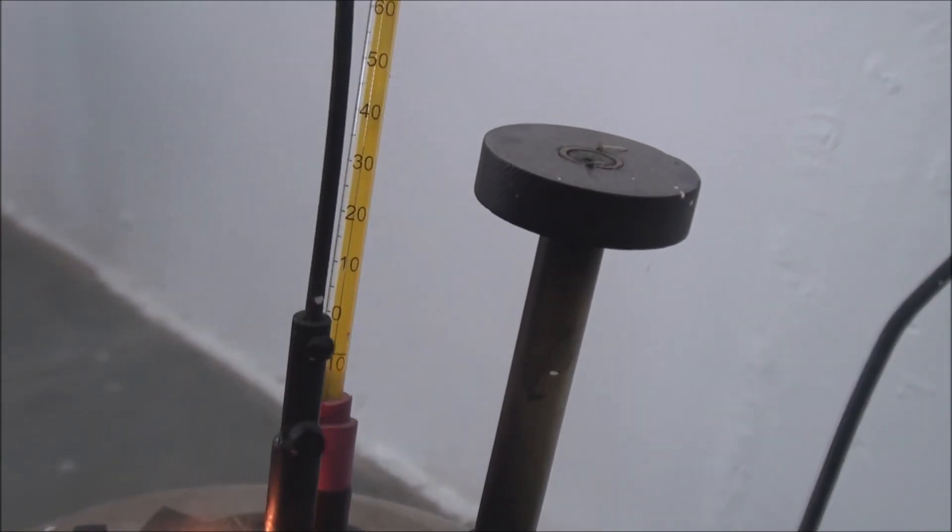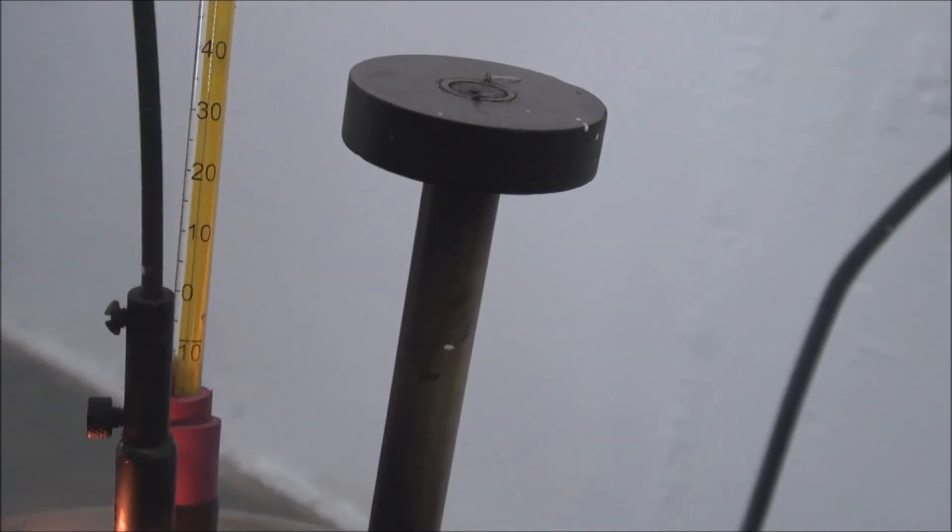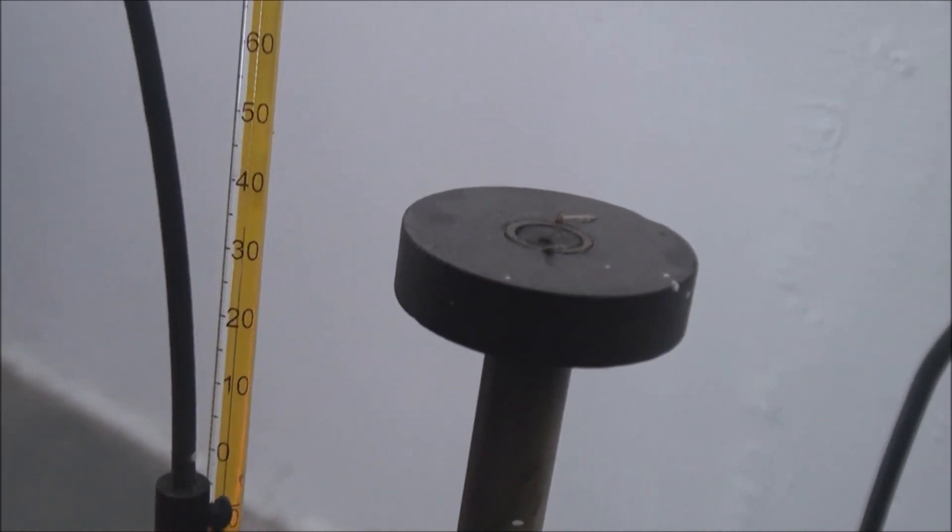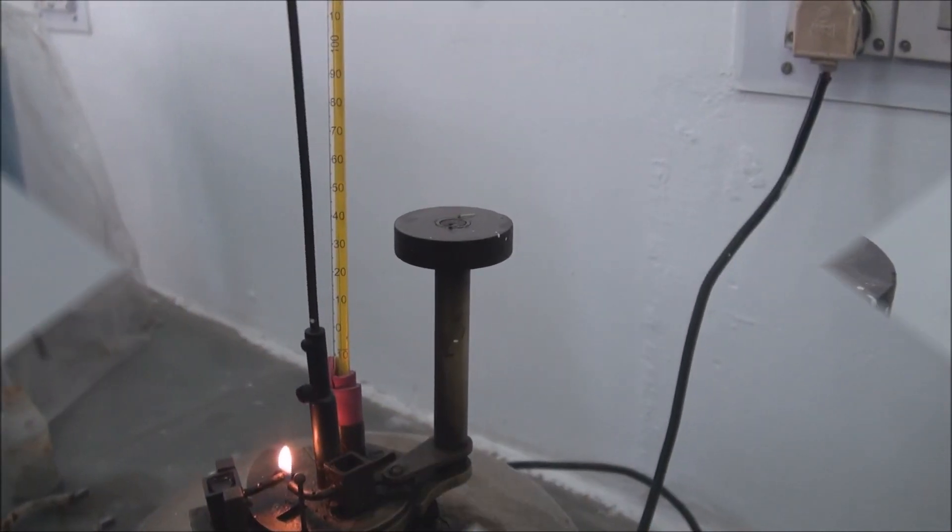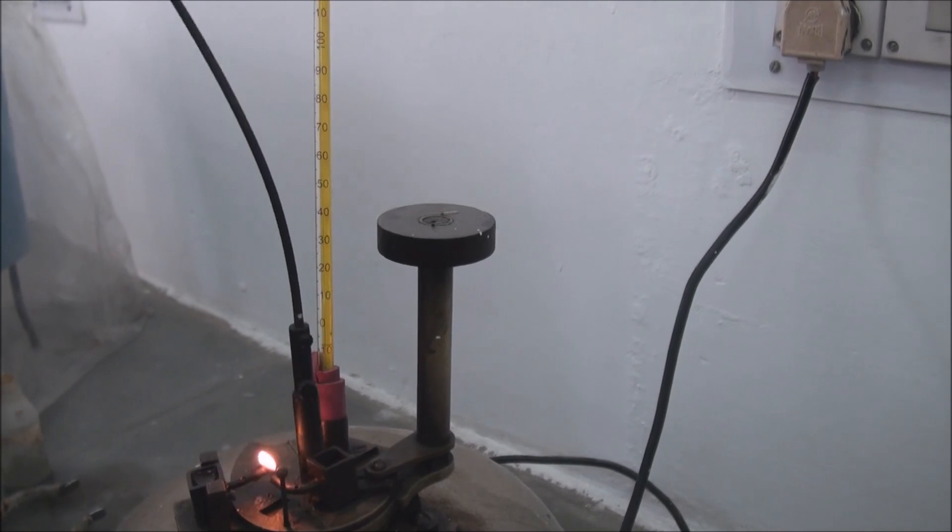Continuously stir the lubricant and keep noticing the liquid temperature after every 2 degree celsius change in the temperature. Stirring of the liquid is done so as to uniformly heat the lubricant.